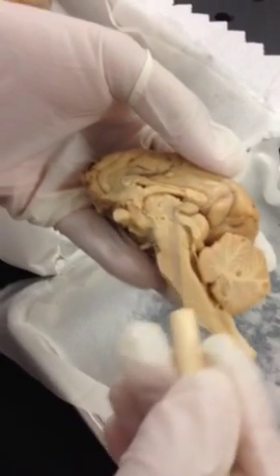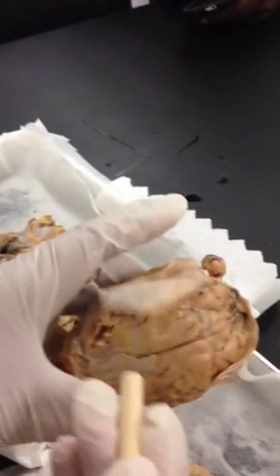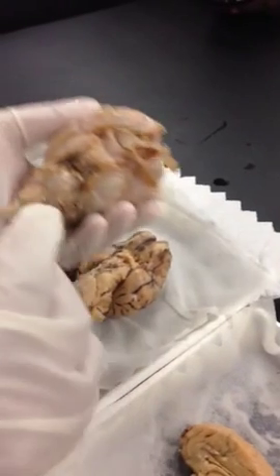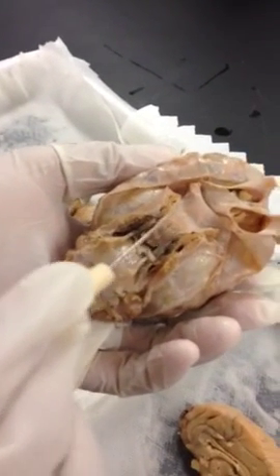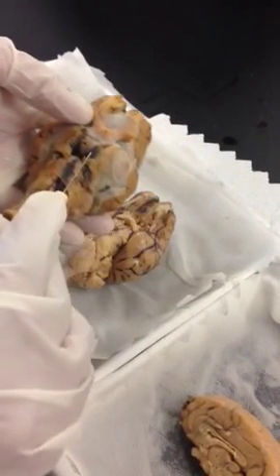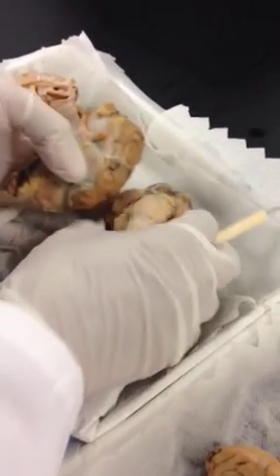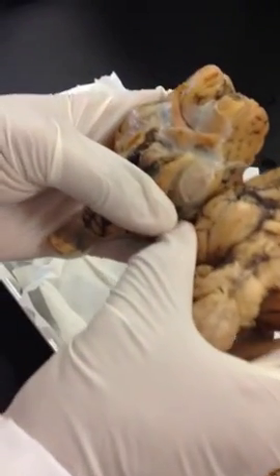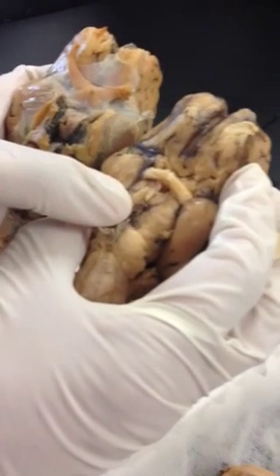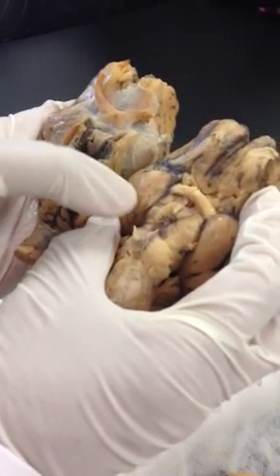Dura mater. Dura mater is the fibrous covering on the outside. Pituitary gland. Pituitary gland, you can see in the inferior view, you see this bump. That's your pituitary gland. You can see this here. So if the pituitary gland is not there, it looks like this. So you can see the difference between the two, with and without the pituitary gland. Here you can see the pituitary gland. Here you don't see it. You can see the infundibulum and mammillary body when the pituitary gland is removed.